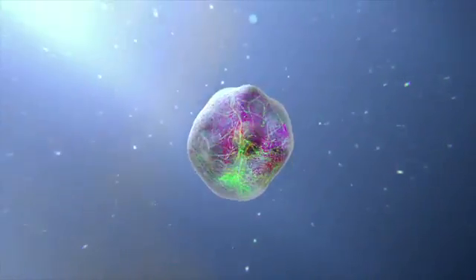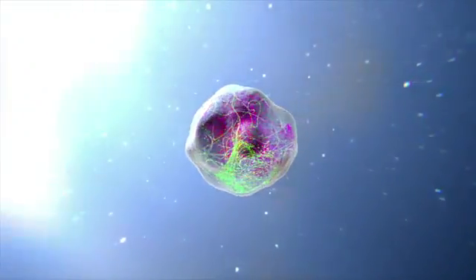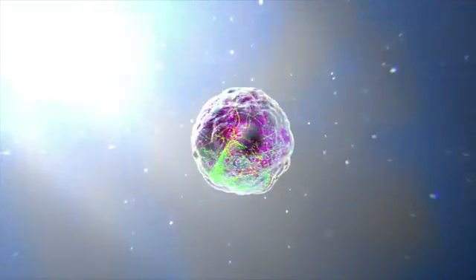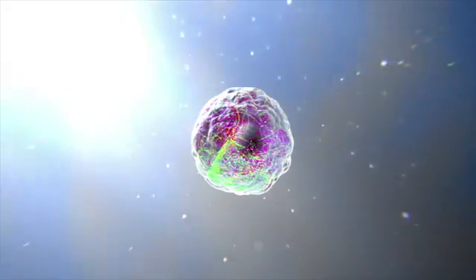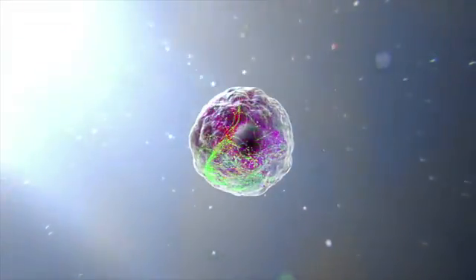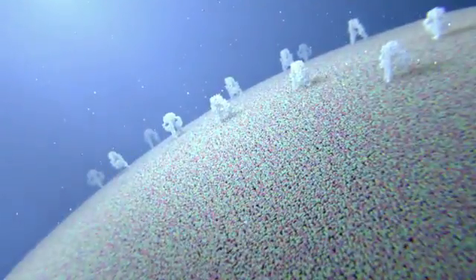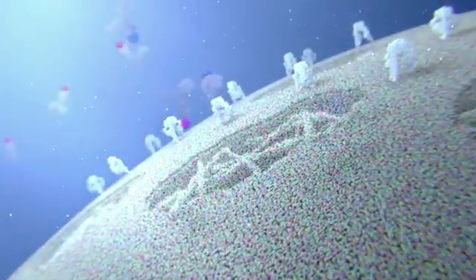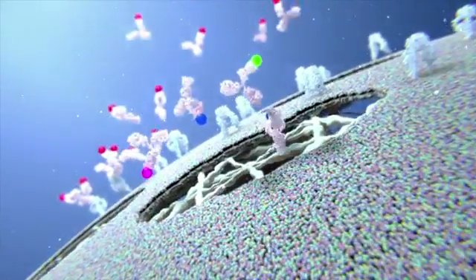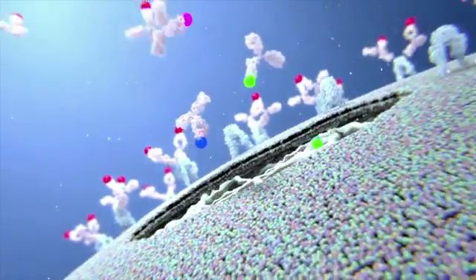The first step of intracellular flow cytometry is fixation of the cells using formaldehyde, which immobilizes proteins and preserves transient signaling events. Cells are then permeabilized with methanol or detergent, allowing antibodies access to the intracellular space.